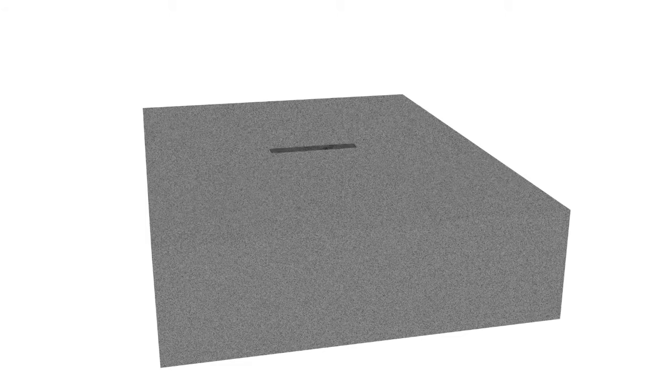First, a platinum mask is applied on the desired location. This allows to make a cleaner cut with the ion beam and protect the underlying material.